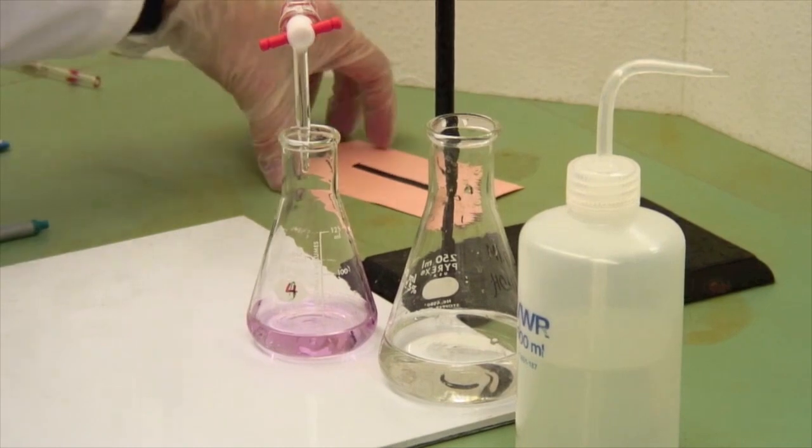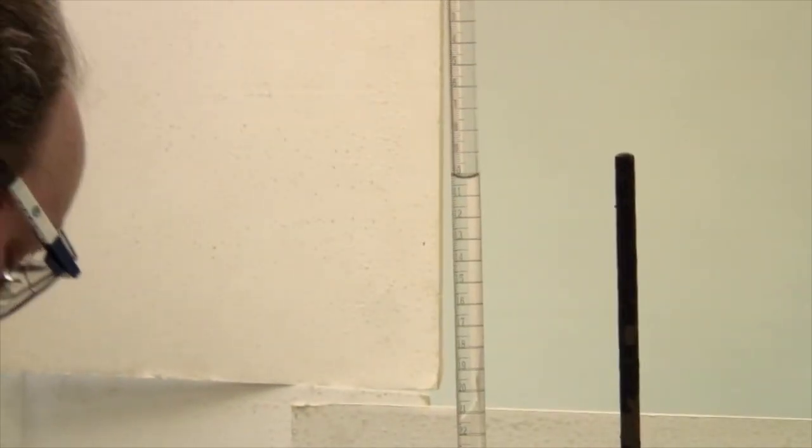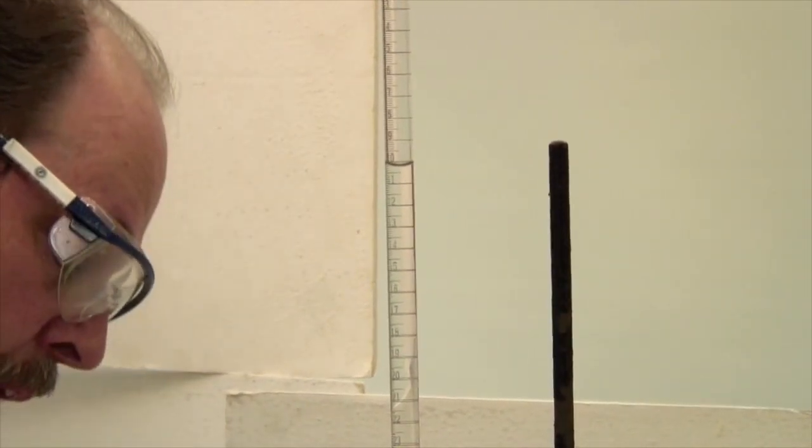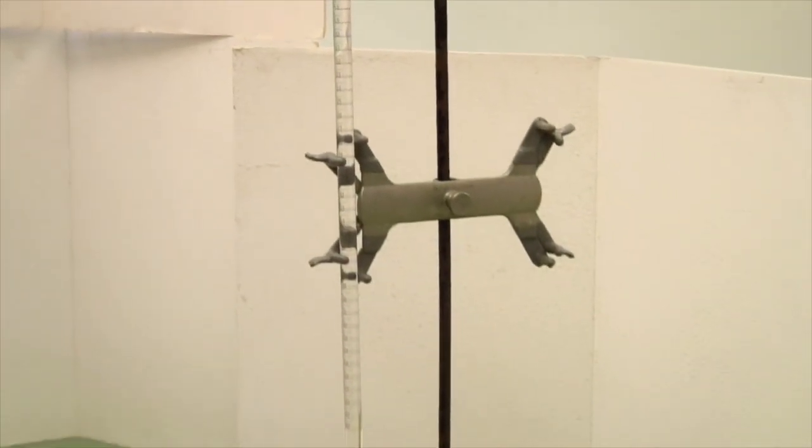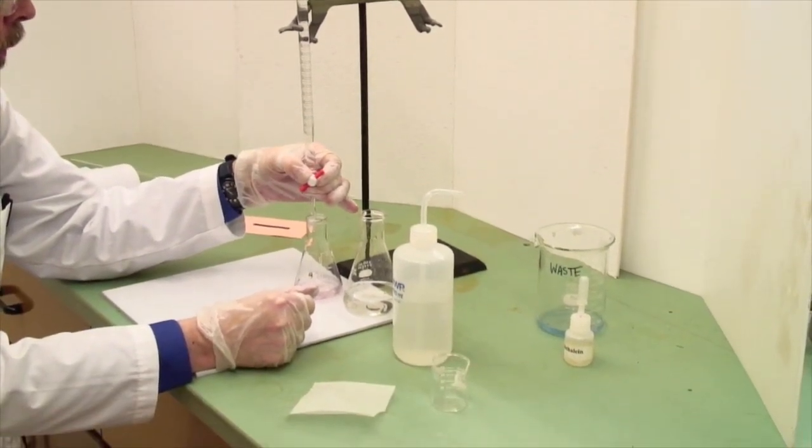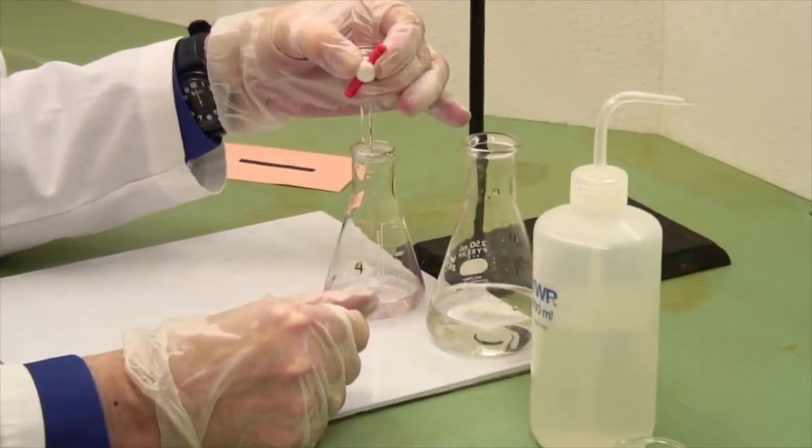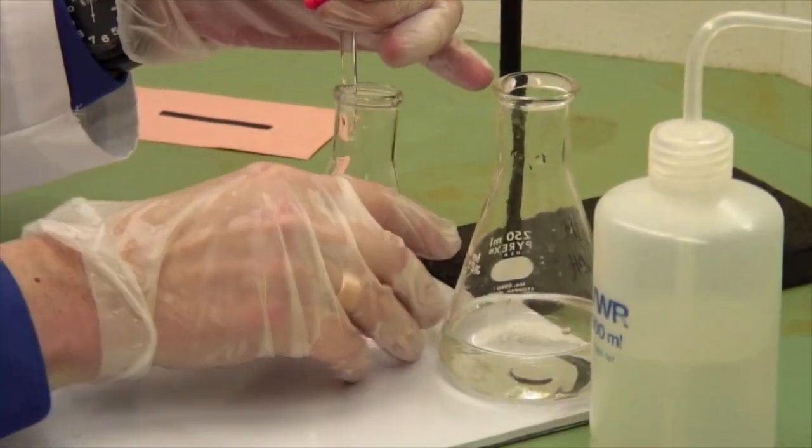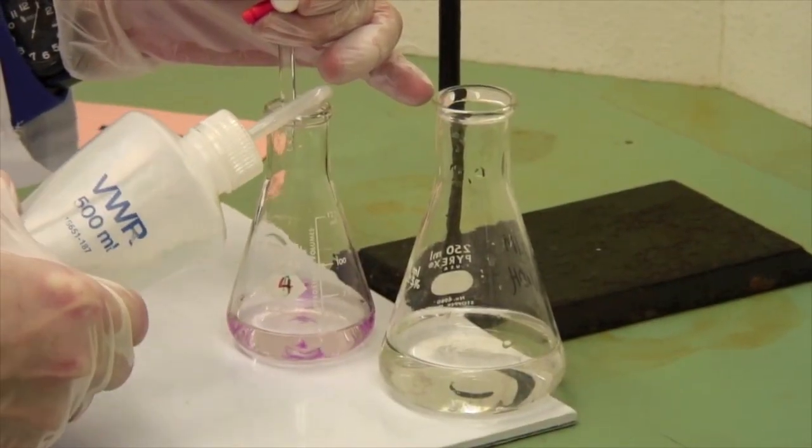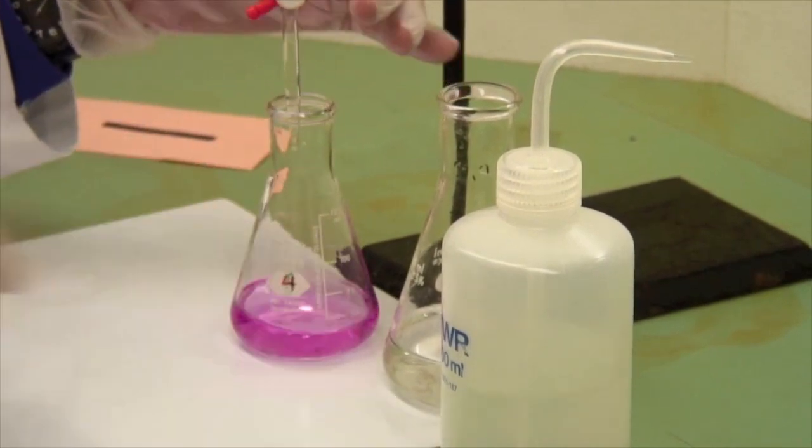And at this point, you read the burette again, and I've got 10.2. If you're in doubt and you think, oh, that's gone away after you've read it, add another half a drop. Because it really didn't last long enough. There we go. Come on. Yeah, that one's not going to go.